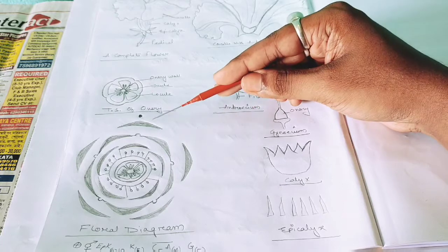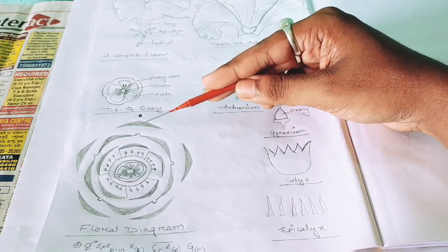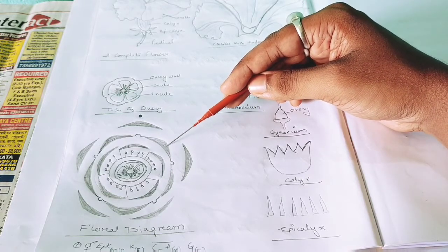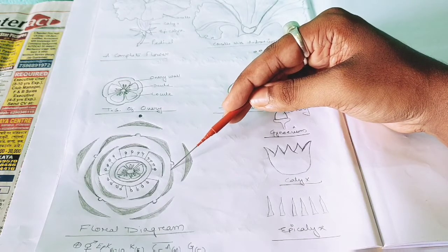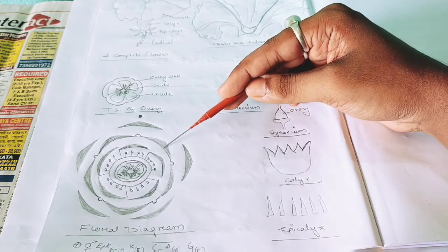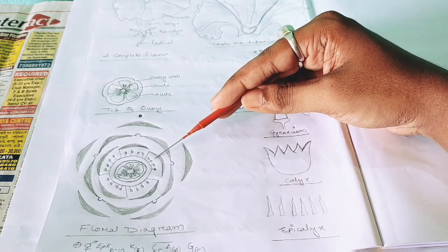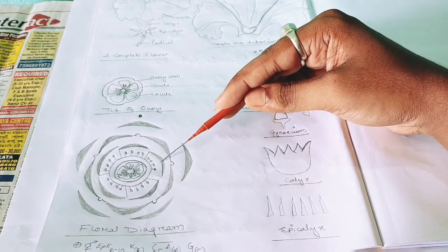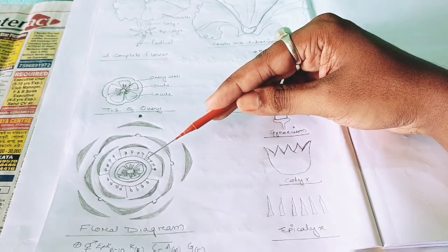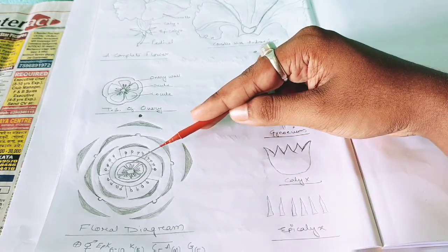And these are the corolla, as I have shown. As the corolla are separate, not fused, it is drawn separately. This is the calyx. As the calyx are joined together, fused, it is shown joined. And the epicalyx are singly joined in one part. They are separate but joined. They have the epicalyx. It is the androecium. These are the androecium, and this is the ovary. You can see this is the ovary part.